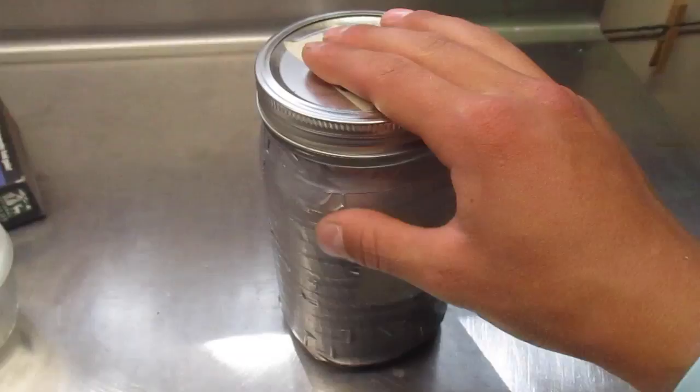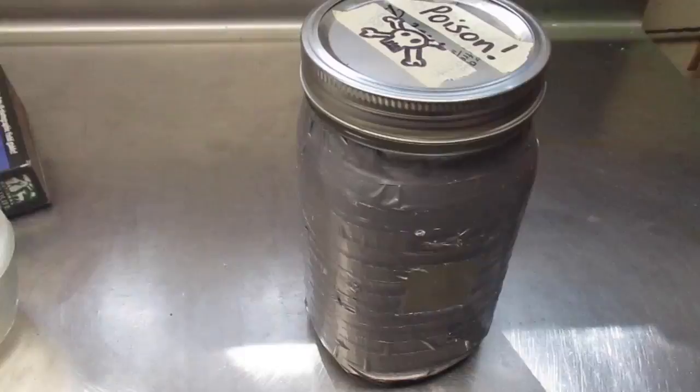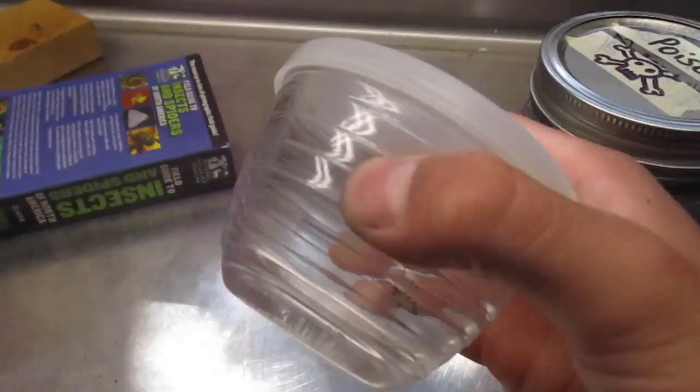But the acetone method is good if you don't have access to a refrigerator or an ice box or anything along those lines — like if you're out in the field for a long time, just have a container like this. Sometimes what I do is if I'm just on a day mission, I'll put it in a jar and then freeze it when I get home.